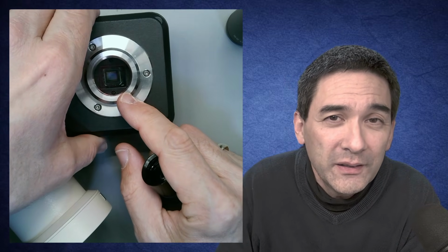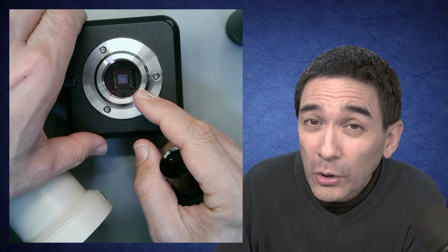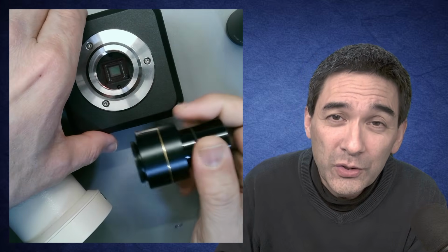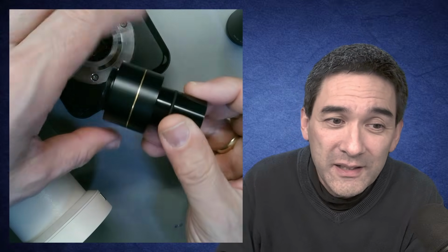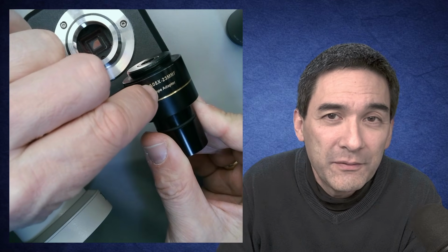If you don't do that, you'll have a lot of so-called empty magnification. The image is going to be larger, much more blurry, and also darker. That's not what you want, so the image quality suffers. In order to get a better image quality, you actually have to make the image smaller so that it's able to fit on the sensor here, and hence the reduction of 0.5 times.